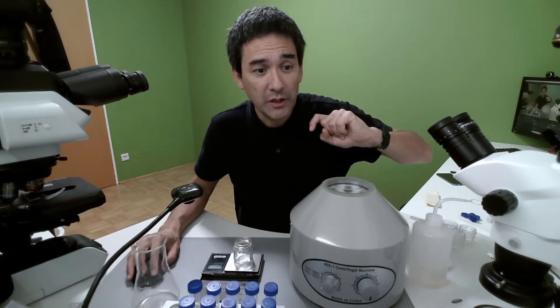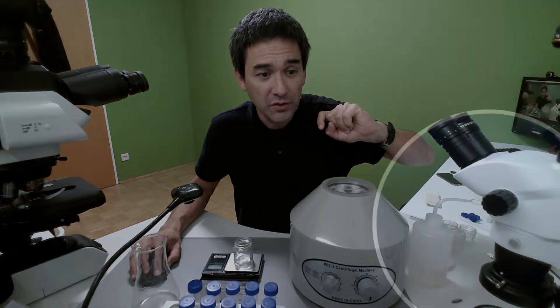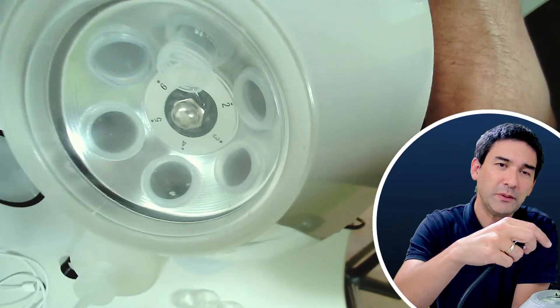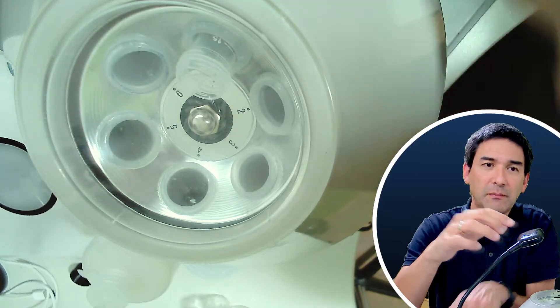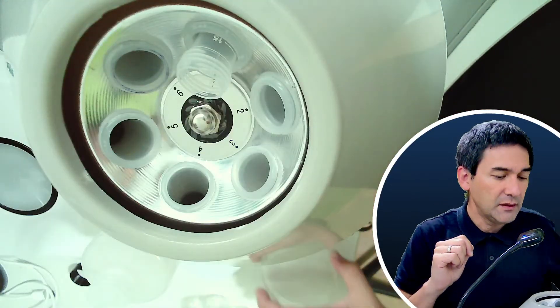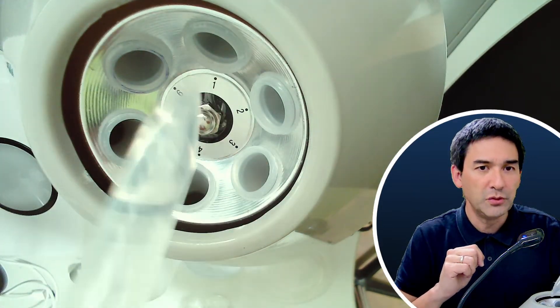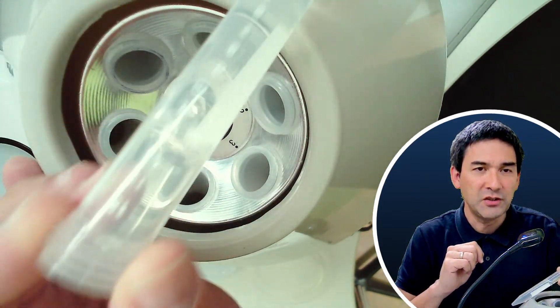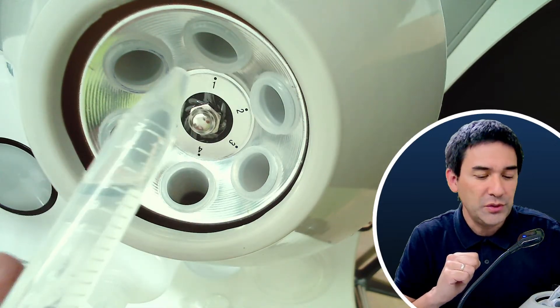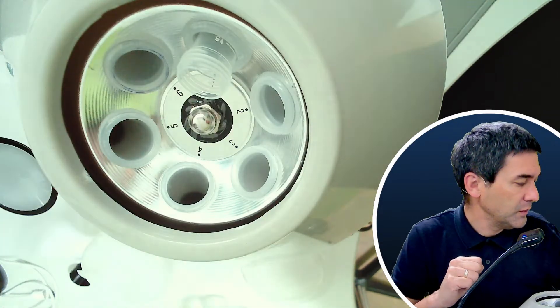Now I'll switch the camera view to show you what the top of the machine looks like. There is a little plastic lid on top, and over here there are slots to put in those plastic centrifugation tubes — they're pretty cheap and disposable.